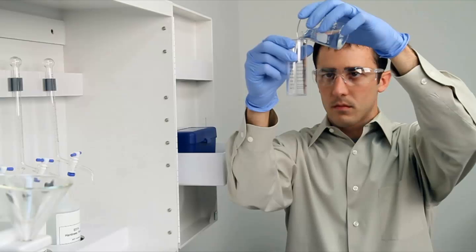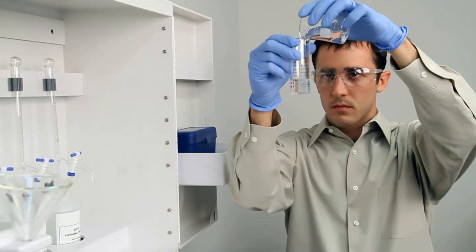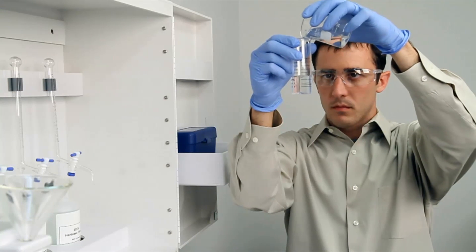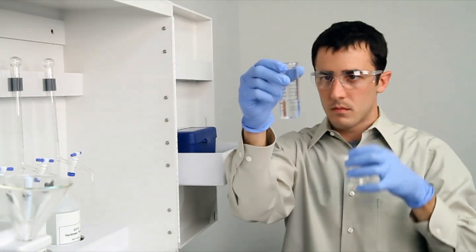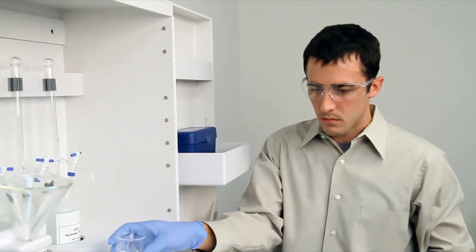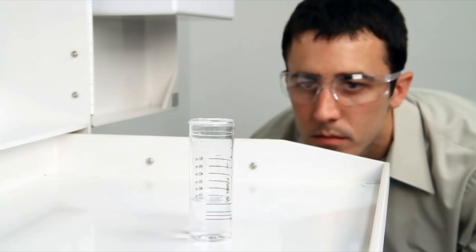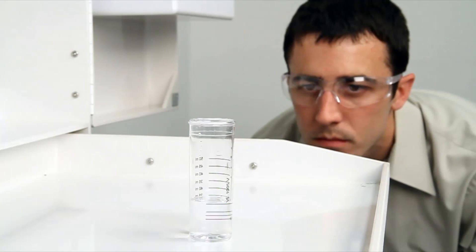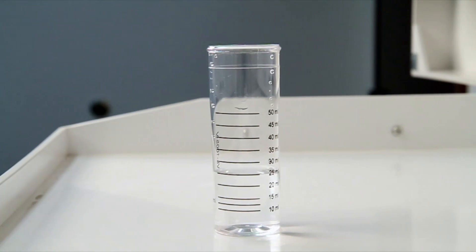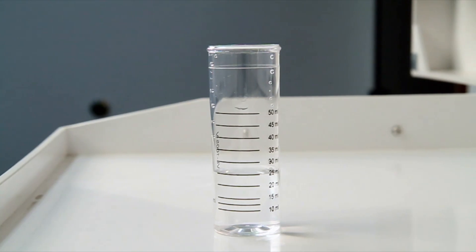To get an accurate sample size, you want to hold the vial close to eye level. Once you feel you have an accurate sample, place the vial on a level surface and bend down to eye level. When performing a drop count titration, a white background can provide contrast to better see the color changes. A cabinet tray or white paper towel can provide that contrast.